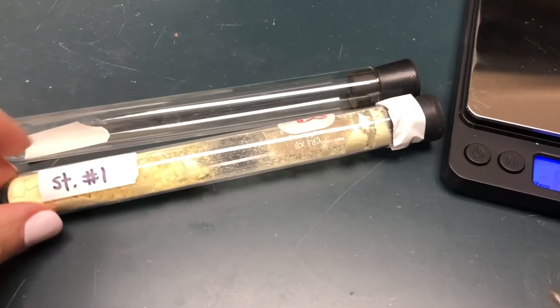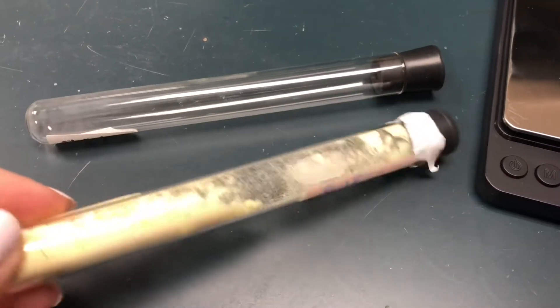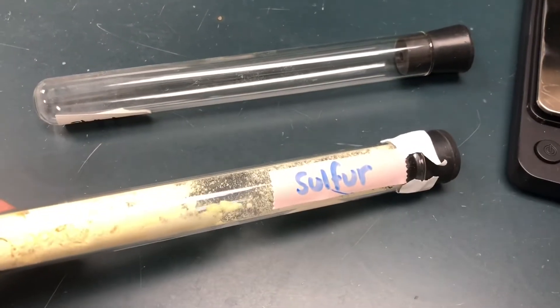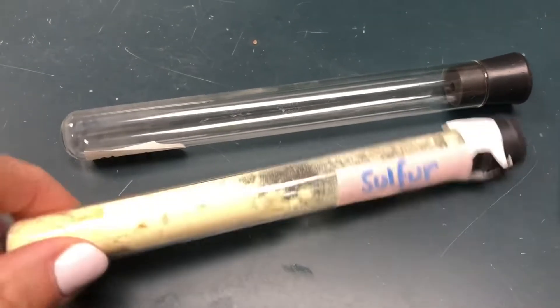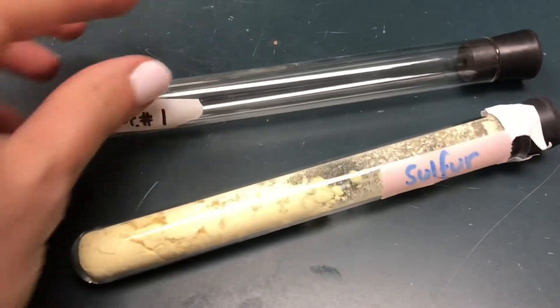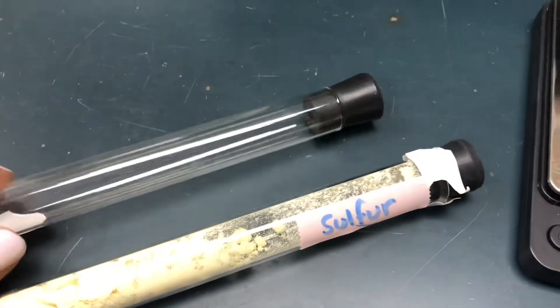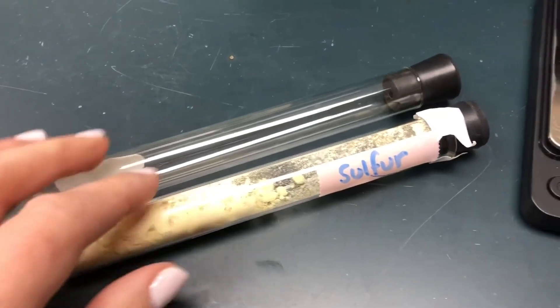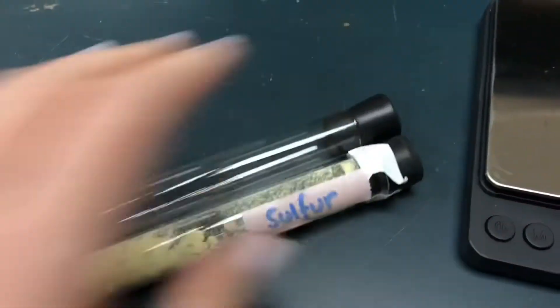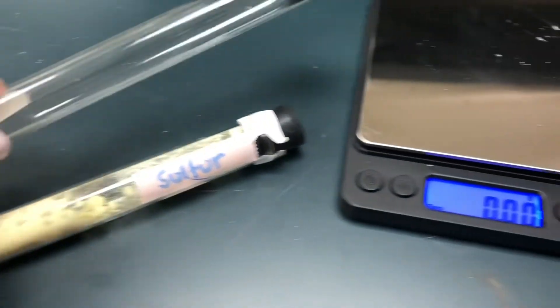In this test tube I have a sample of sulfur, and then I've got an empty test tube right here. Both test tubes are the same size with the stoppers, so I'm going to weigh my empty test tube first to get you that data.